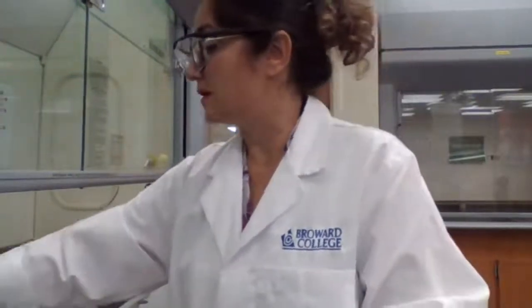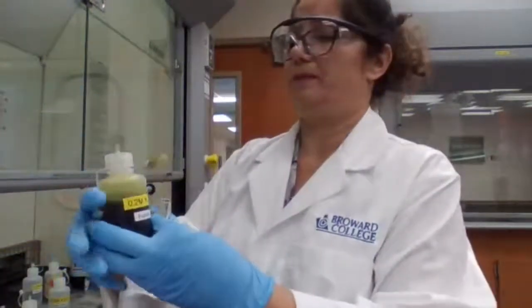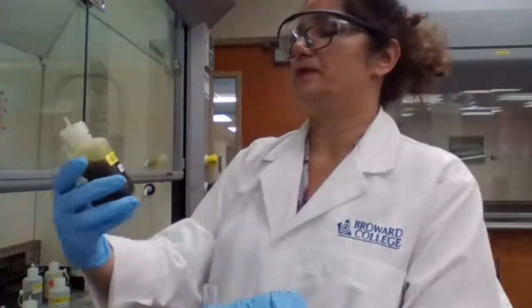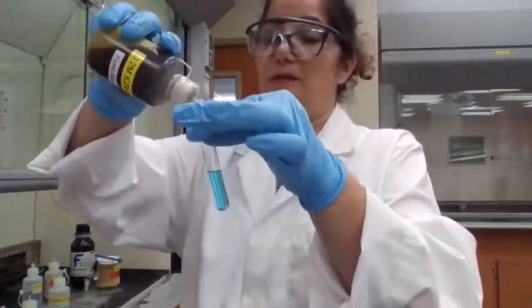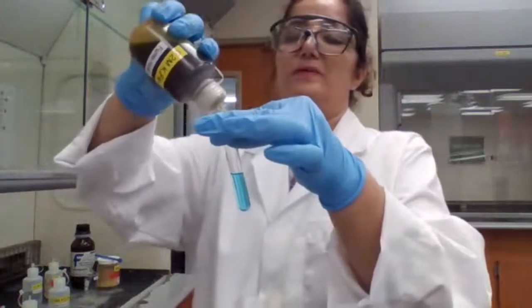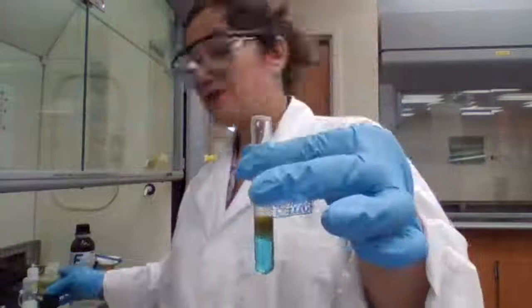Okay, potassium ferrocyanide. We are going to add a couple drops of this. Okay, it actually formed.